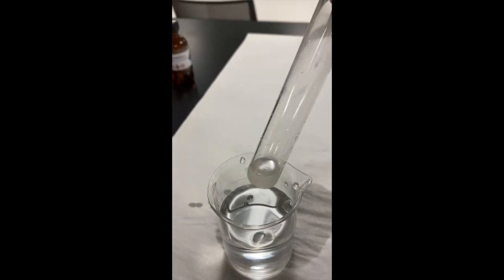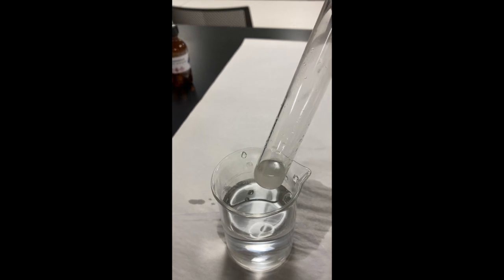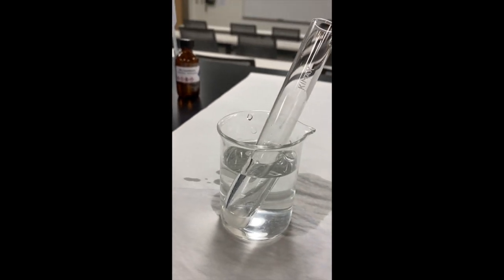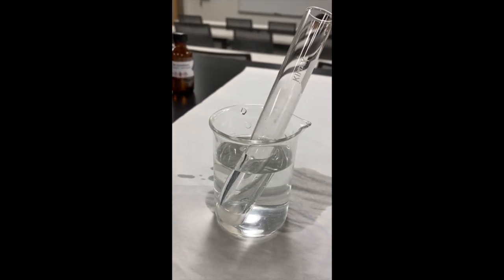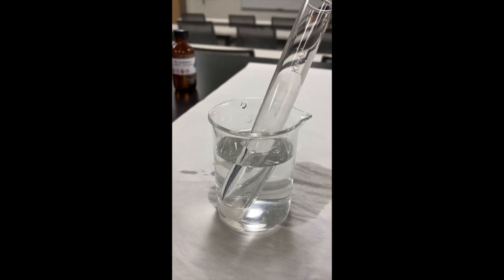It's been almost 10 minutes in the warm bath. Nothing happened. So for our data, we're going to have to say that benzaldehyde had no reaction. Now here's the thing. We know it's supposed to because it's an aldehyde. So that means when you write your conclusion, you need to make sure that you include the fact that the benzaldehyde did not react, but it should have.